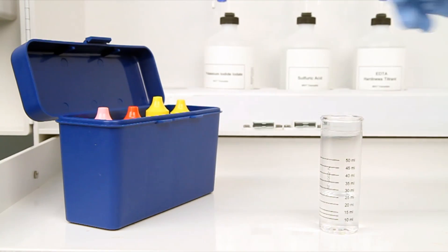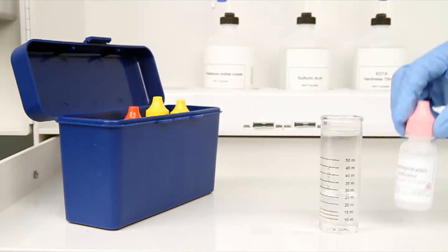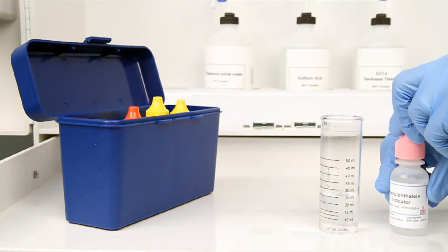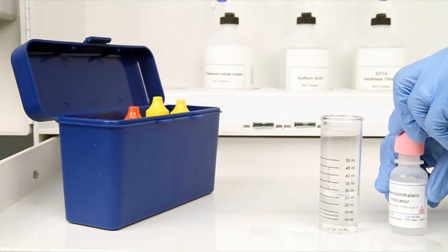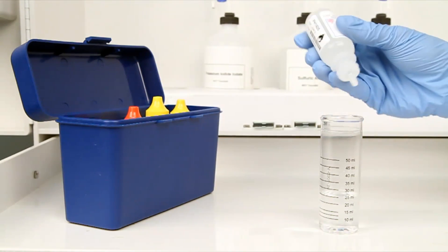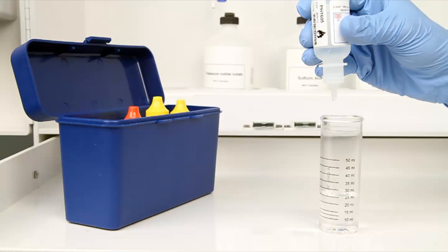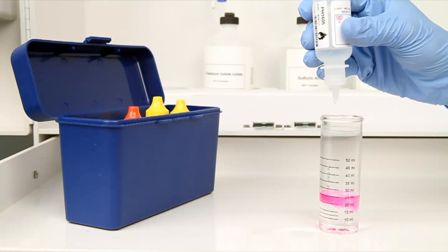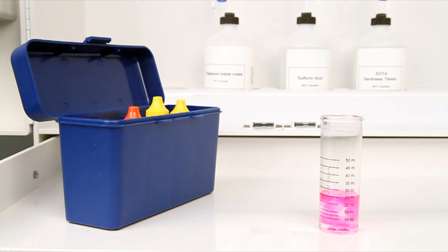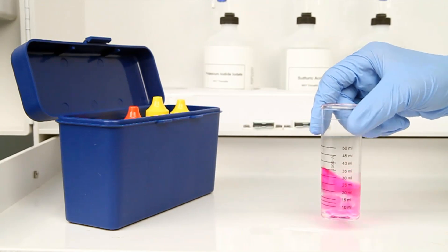The next step according to the Endpoint ID procedure is to add two drops of phenolphthalein indicator. The bottle contains a dropper tip, so it is important to hold the bottle vertically to get a consistent drop size. After the addition of each reagent, it is important to swirl the vial to make sure the reagents are properly mixed.